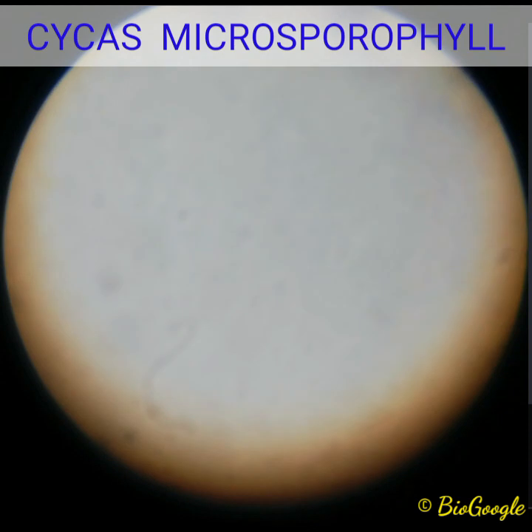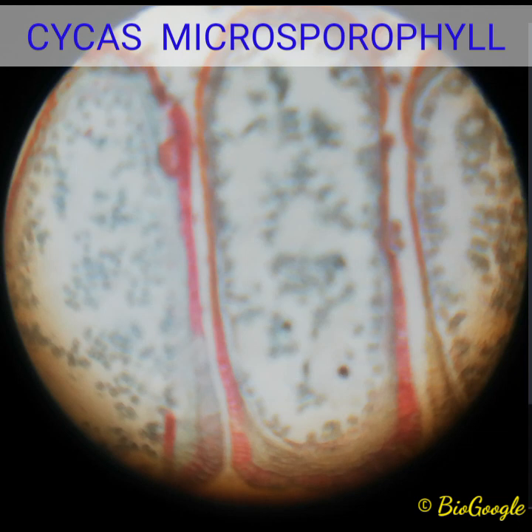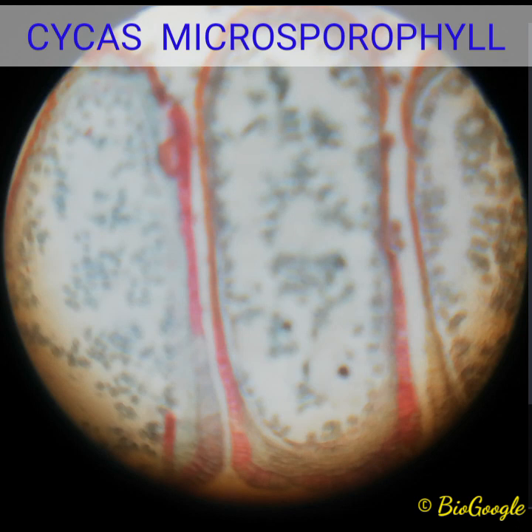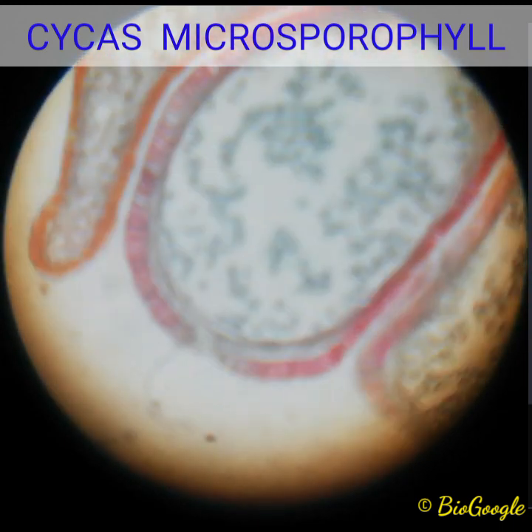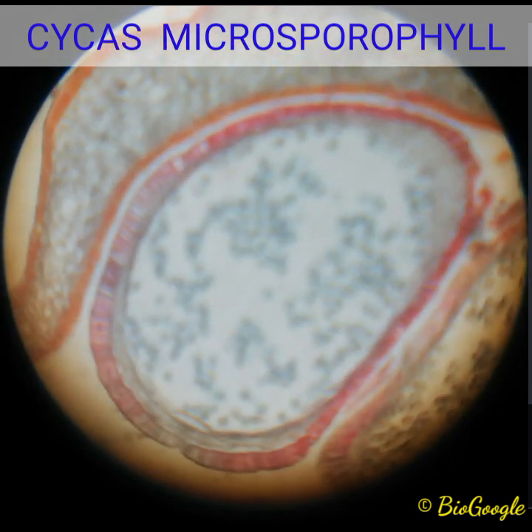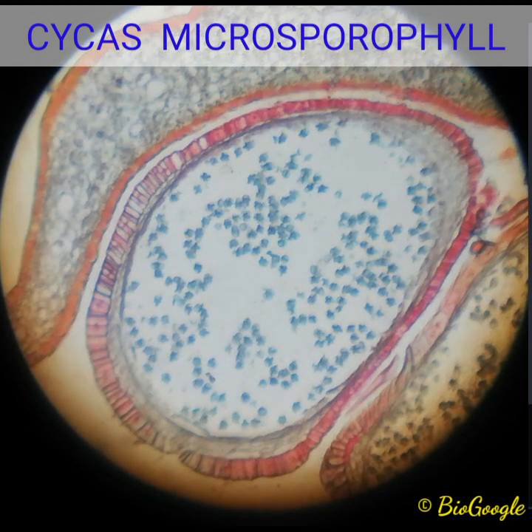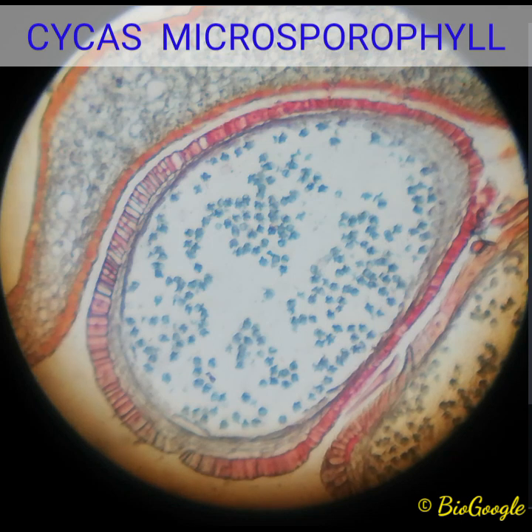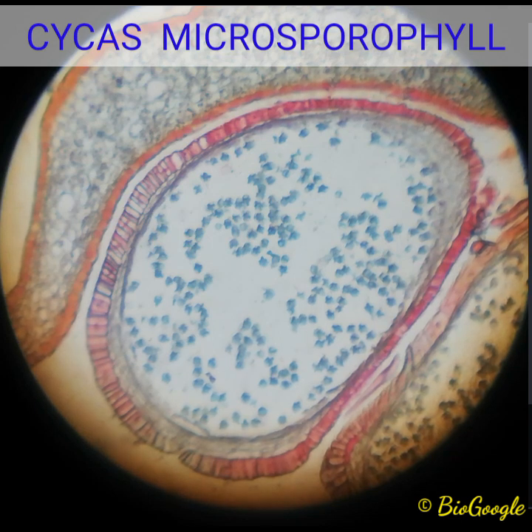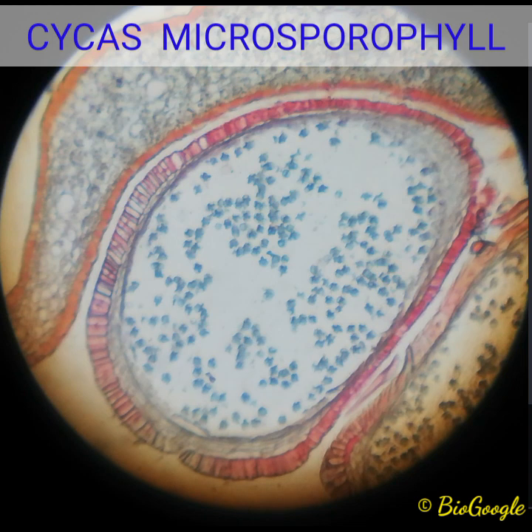Let us take the cycas microsporophyll — the microsporophyll of the cycas. You must remember that whenever we use the word 'micro,' it refers to the male gametophyte, the male reproductive part of the plant. Whenever we refer to 'mega,' it is the female reproductive part. Here it is the microsporophyll of the cycas plant — one of the microsporangia that produces microspores after meiosis. The pink structure is all microsporangia. The microspores are produced inside, and later when the microsporangia dehisces or bursts out, the pollen grains are released.